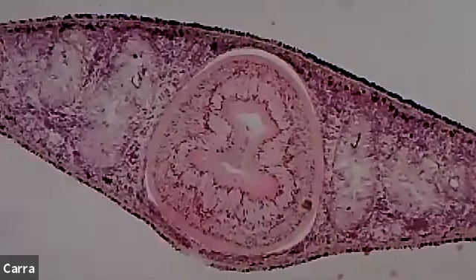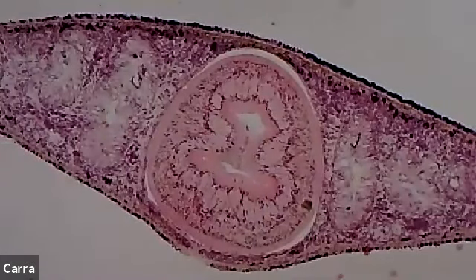And one of the things that you will learn from the handout and the PowerPoints and all of that is that planarians have a feeding tube, a pharynx, and the pharynx extends into the actual body cavity. So that circular thing that you're looking at there right in the middle is actually the feeding tube, the pharynx. It's like a muscularized feeding tube. And I like to think about it kind of like an elephant trunk. Okay, so it can pick stuff up and it can eat with it and it's very muscular.